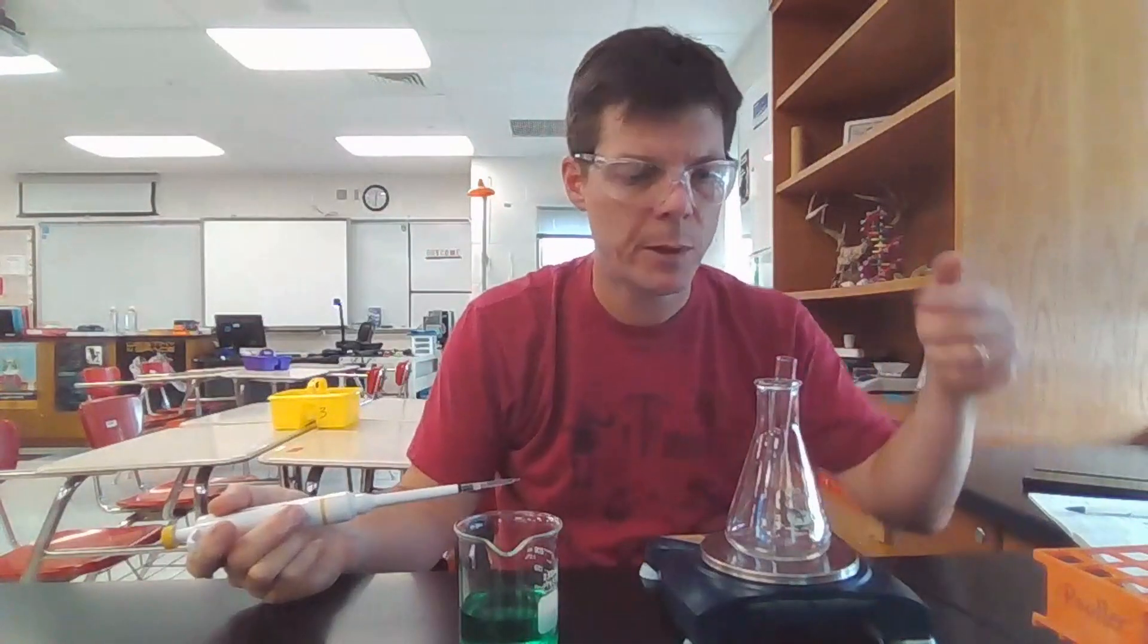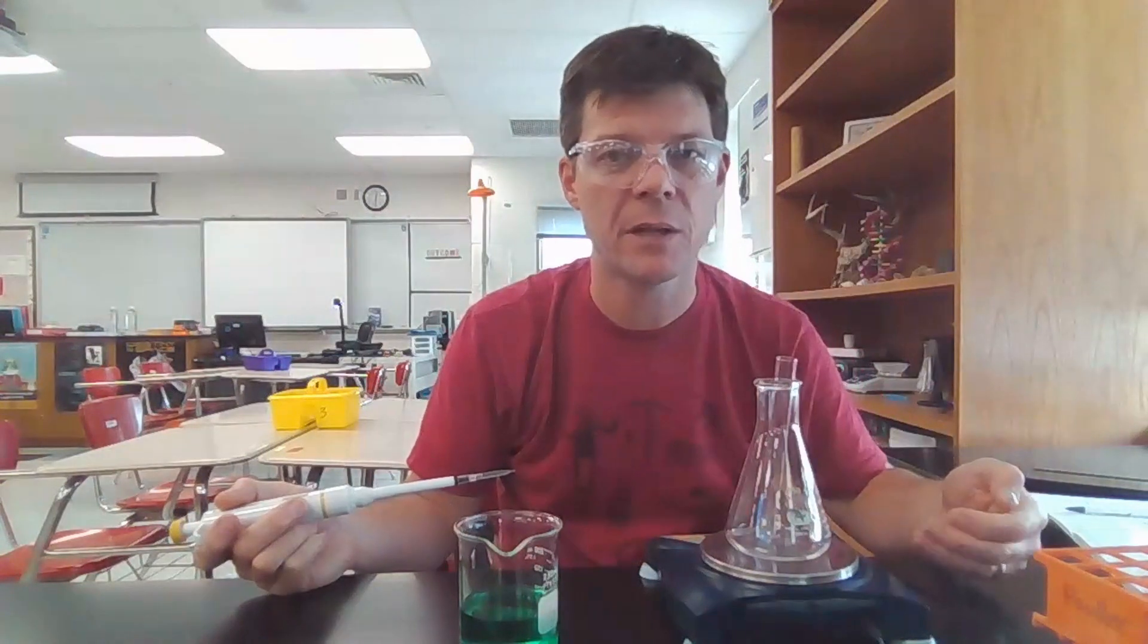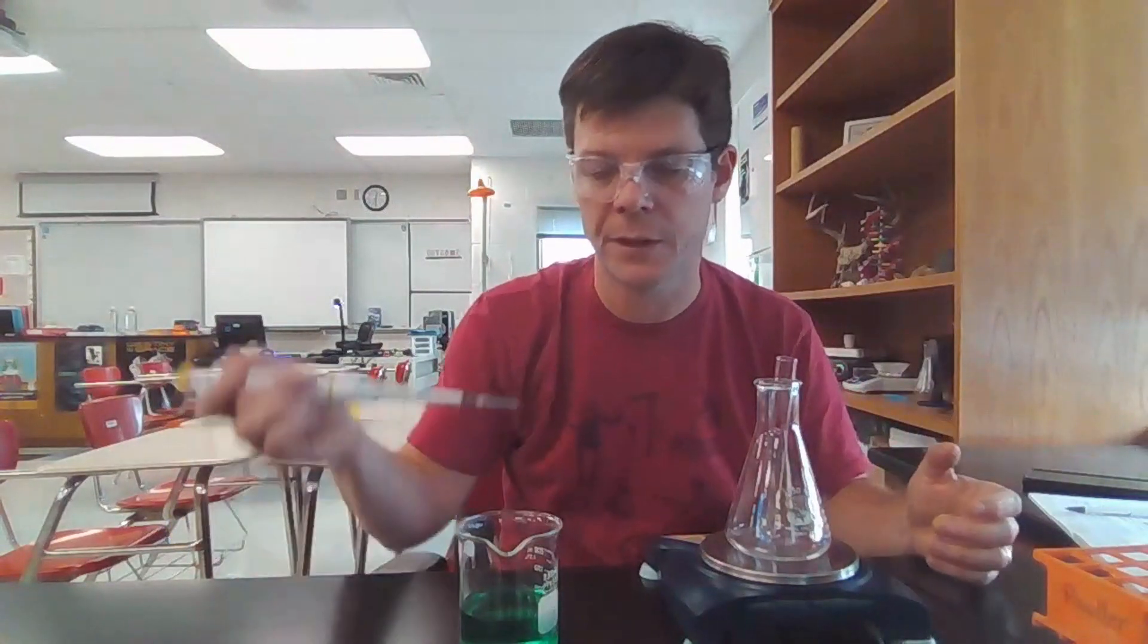When we transfer liquid into the test tube, I'm going to push to the first stop point to push the liquid out of the tip. But then I'm actually going to push beyond that to the second stop point. If there's any liquid that sticks inside the tip, pushing to the second stop point will force that liquid out of the tip.